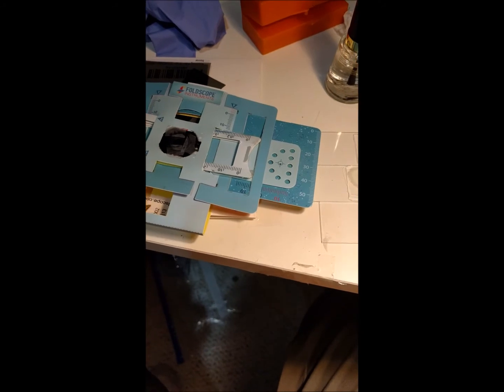Let's look at some sand from Clearwater, Florida. Here's a sample — quartz sand mainly — and you can see the nice sand particles. There's just the analyzer over the eyepiece with no polarizer set up yet, so without the polarizer this just looks like any other view. Those bubbles you see are from the nail polish.